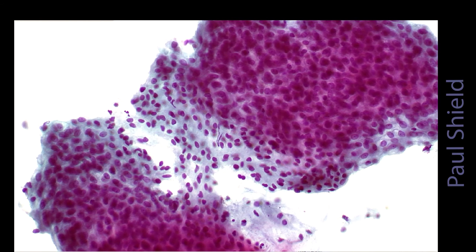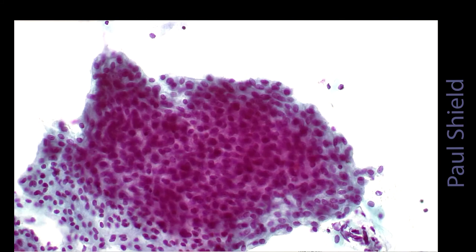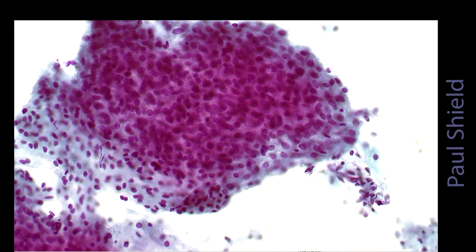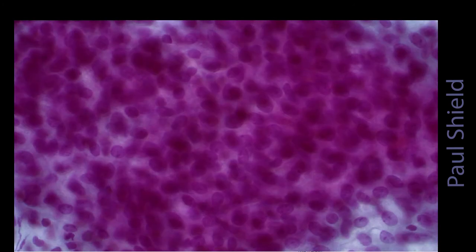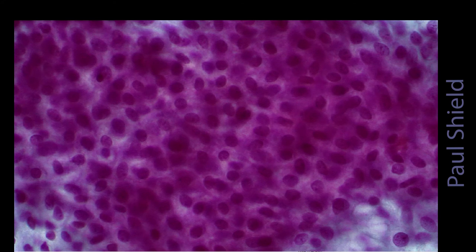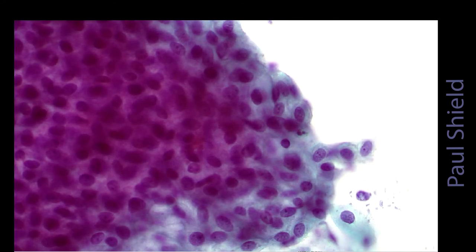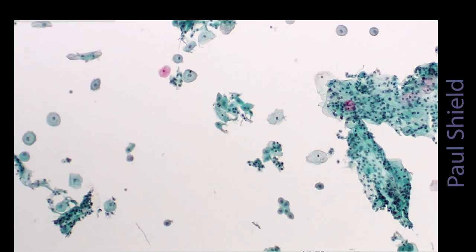I can tell they're squames, they don't have palisading, they don't have honeycombing, and the cytoplasm is fairly abundant. It's dense and homogeneous with a well-defined border, and the nuclei are centrally placed. And you can see there's probably a couple of layers of cells there in that atrophic group. So we would expect this pattern to occur postnatally, postmenopausally, and prior to menarche.